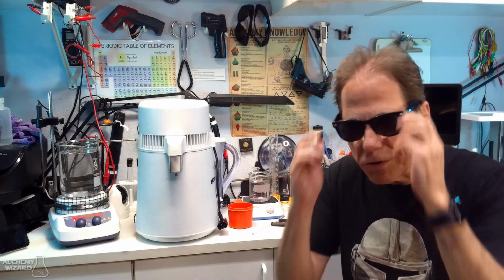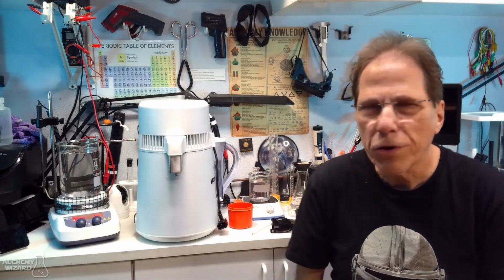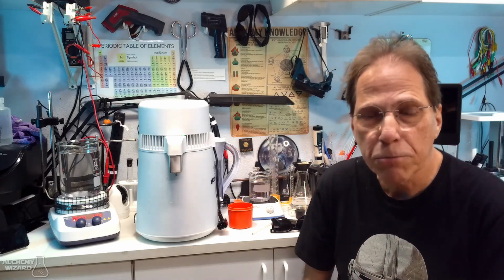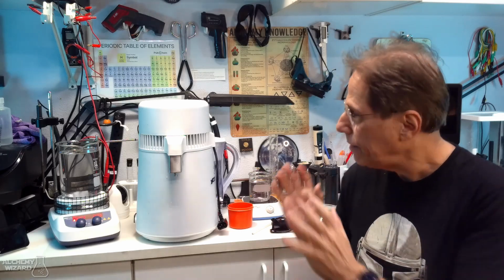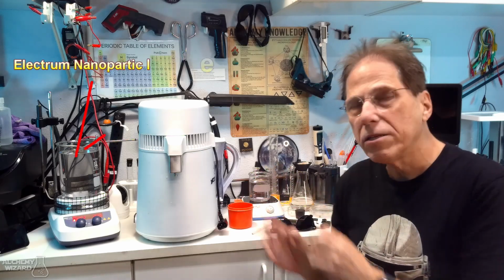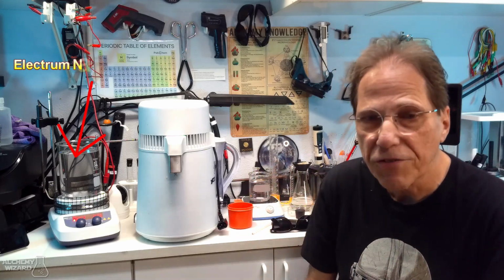It's very important to clean your distiller for whatever you're using it for, be it laboratory use like I use for making my colloidals here, or for the vaporizers and the various breathing machines. They all need distilled water to operate or for cleaning. And because our tap water is not so good, these distillers tend to build up a lot of sediment inside them, and that sediment eventually will get into the distilled water. So you really have to clean the distiller every now and then.